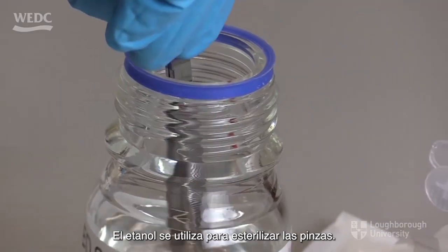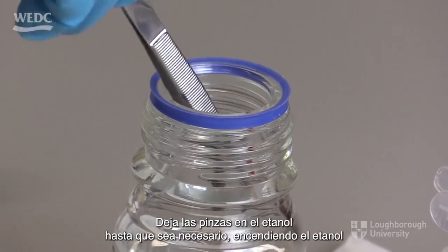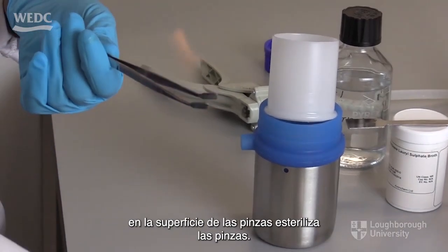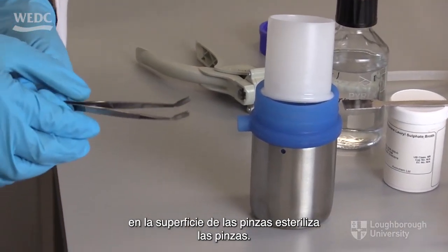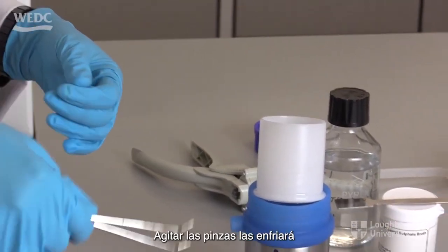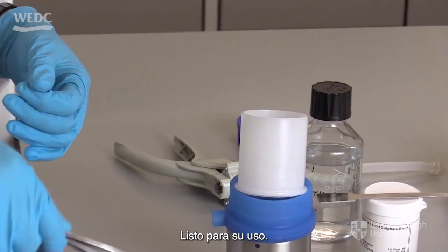Ethanol is used to sterilise the forceps. Leave the forceps in the ethanol until required. Igniting the ethanol on the surface of the forceps sterilises the forceps. This should be done every time they are used. Shaking the forceps will cool them down ready for use.